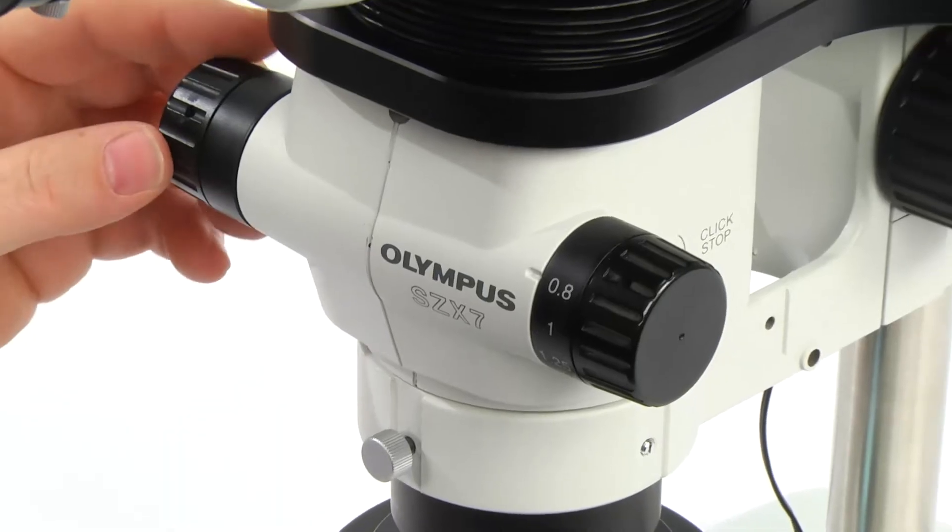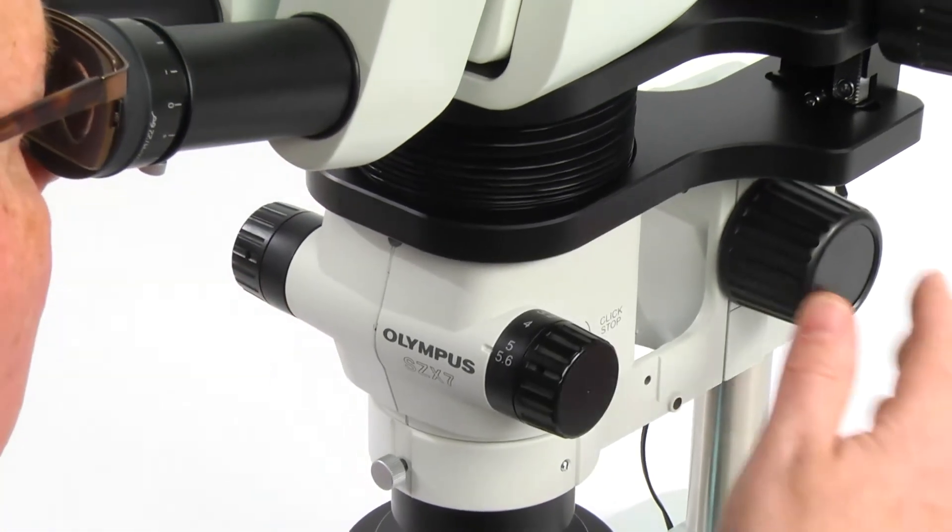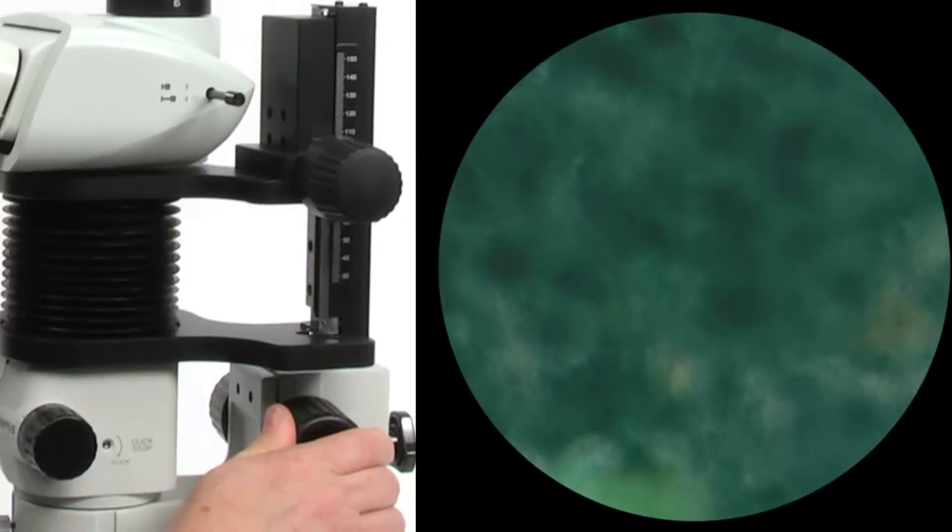Next, set the zoom adjustment knob for the highest magnification and rotate the focus adjustment knob to bring the sample into focus.